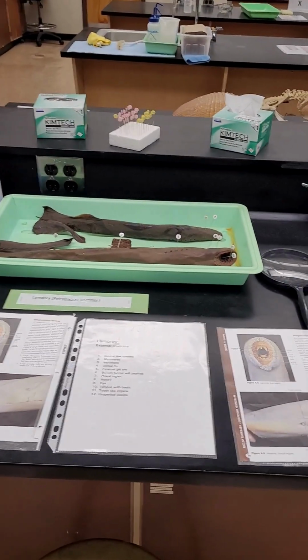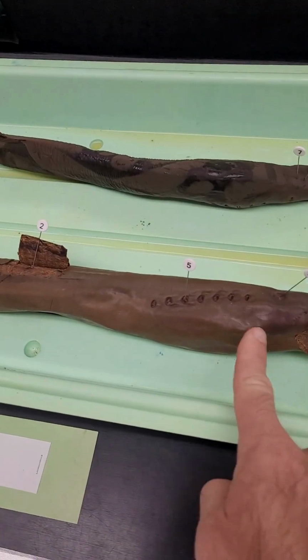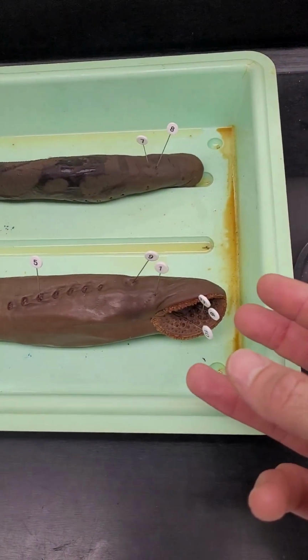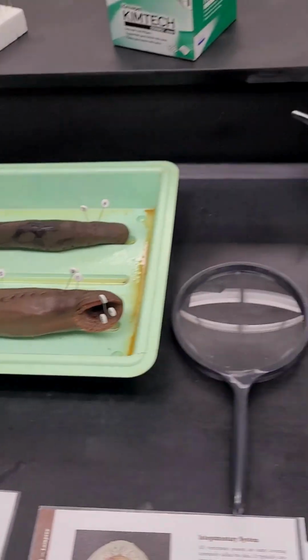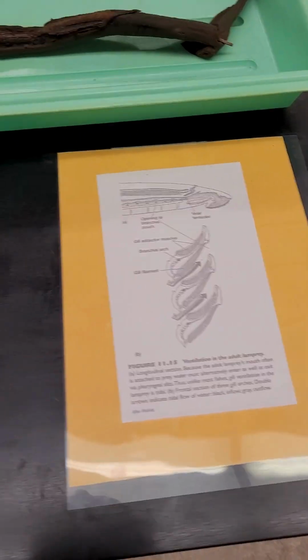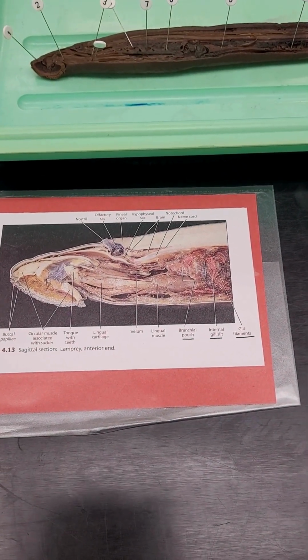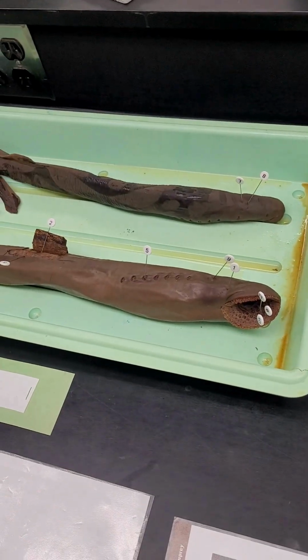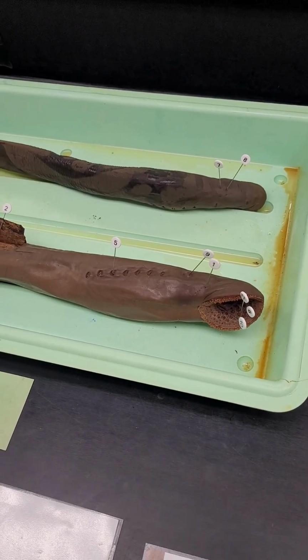condition. So the emphasis here is really to recognize in the external anatomy that we have our external gill slits, because this has the respiratory system, but it's also going to be sucking blood, and so it's going to have a digestive system and needs to partition those. And so the major theme is that they have a velum for doing so here, which allows the partitioning of the esophagus and the respiratory tube. So if we focus in on the respiratory system, there would be the emphasis on the branchial baskets with the internal and external gill slits to enter that and to leave that.